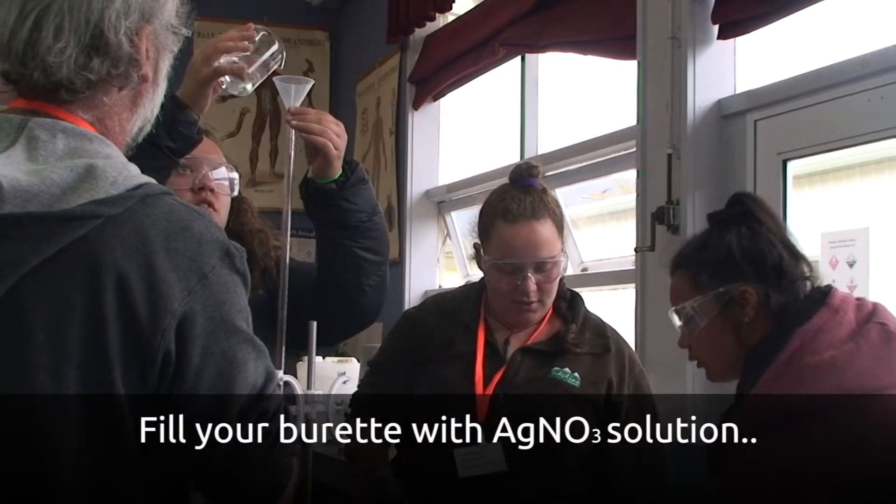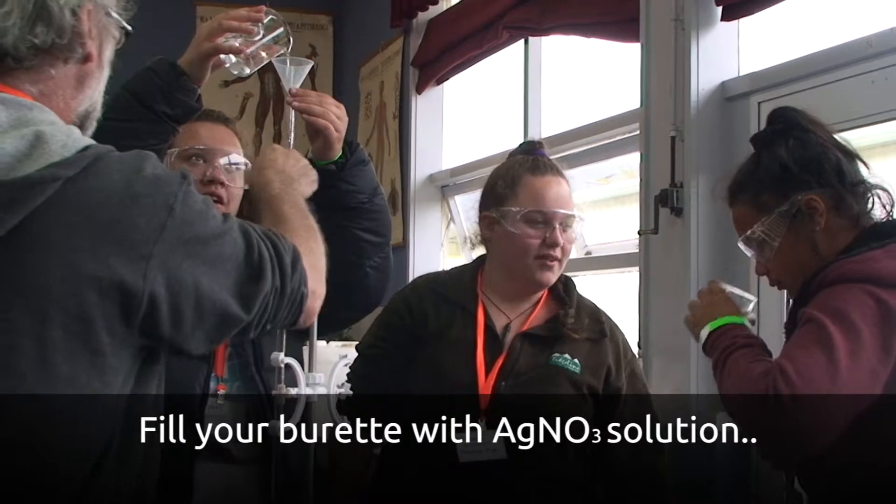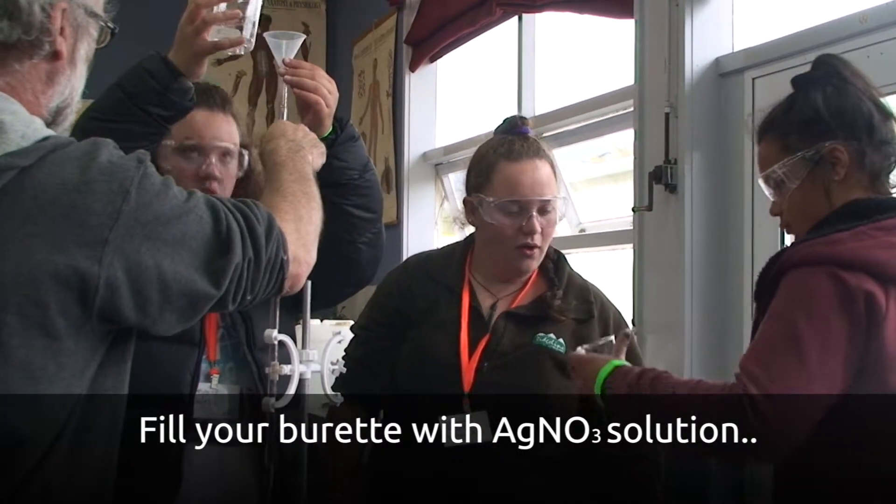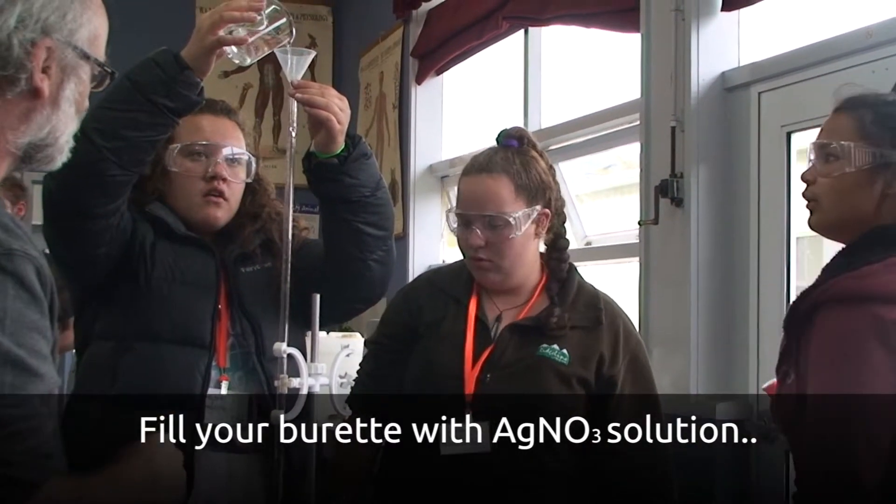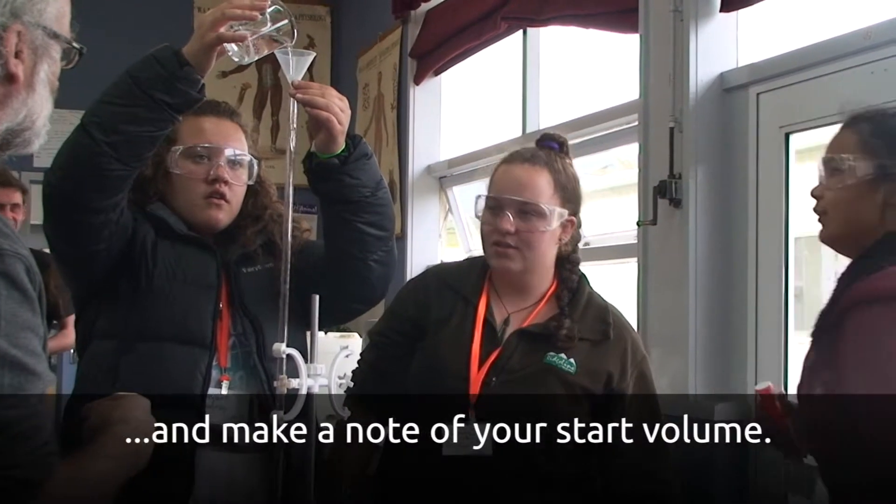And I'm now going to pour the silver nitrate solution in. Carefully, because they fill up really quickly, and if you do it wrong, you get silver nitrate everywhere.